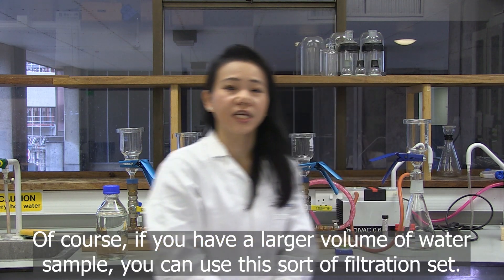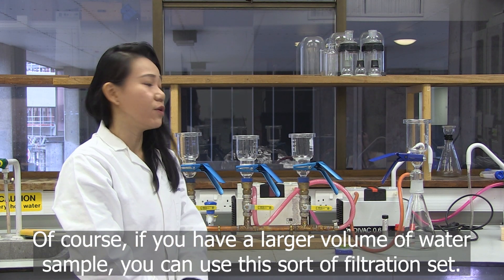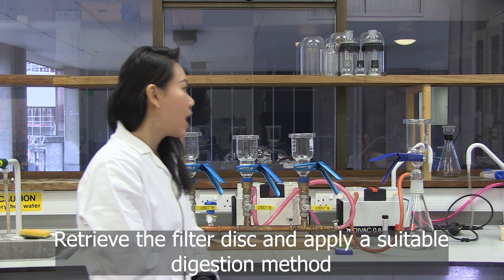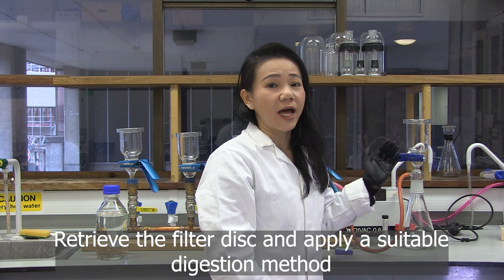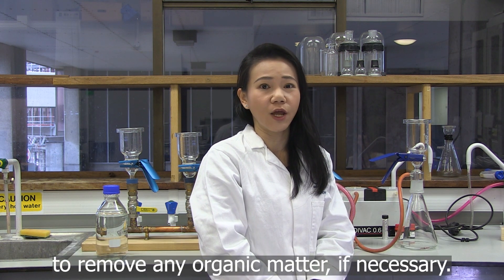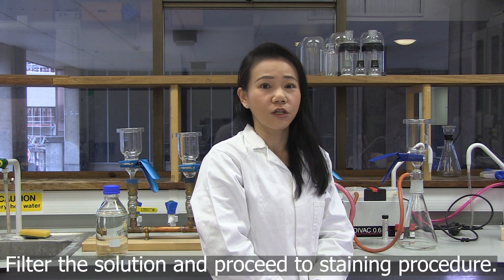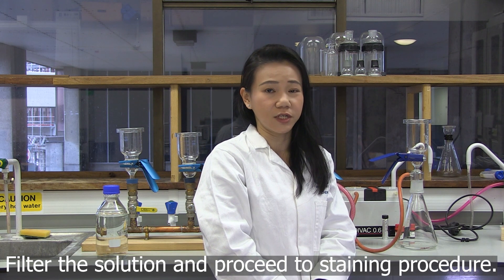If you have a larger volume of water sample, you can use this sort of filtration set. Retrieve the filter disc and apply a suitable digestion method to remove any organic matter if necessary. Filter the solution and proceed to the staining procedures.